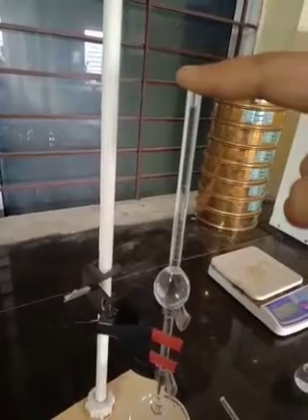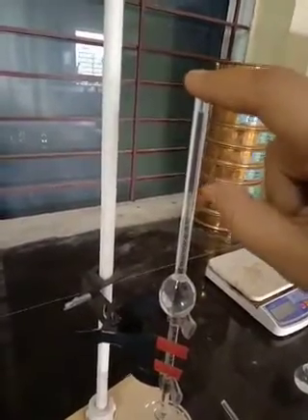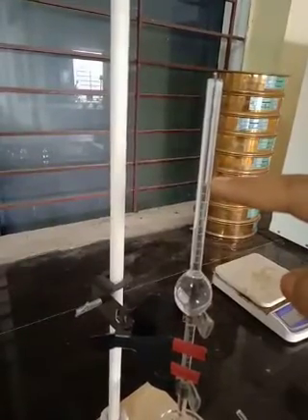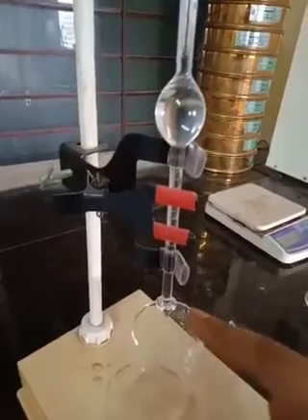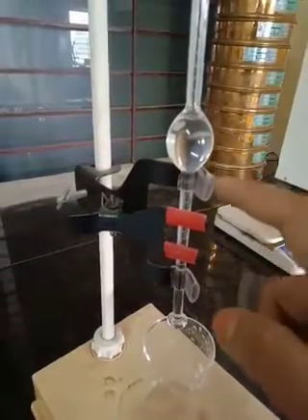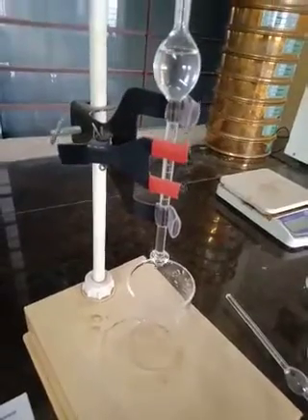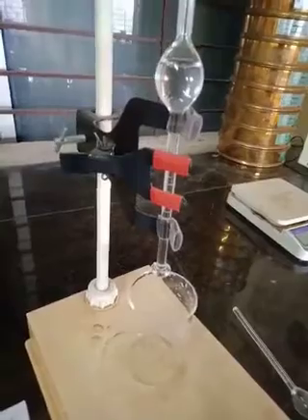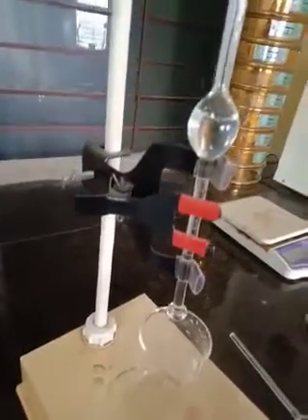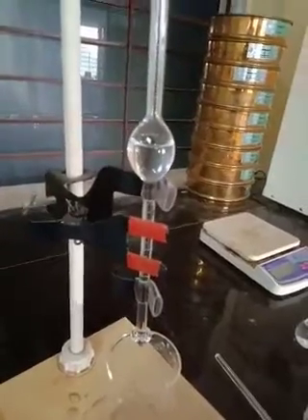Fill the stalagmometer with purified water and count the number of drops falling between points A and B. We start the drop count, take three readings, then empty the stalagmometer and repeat the process at least three times. Then repeat the same process with the test liquid and note down the drop count.